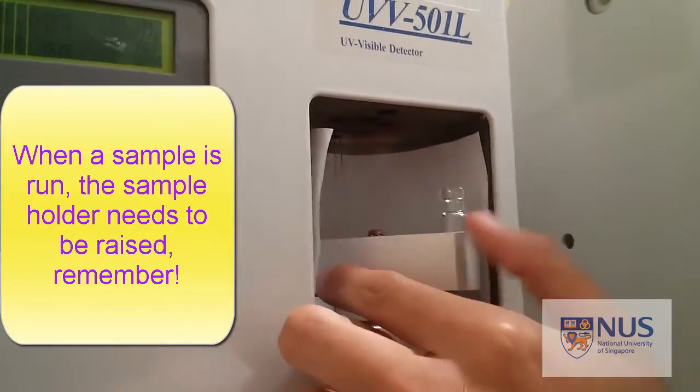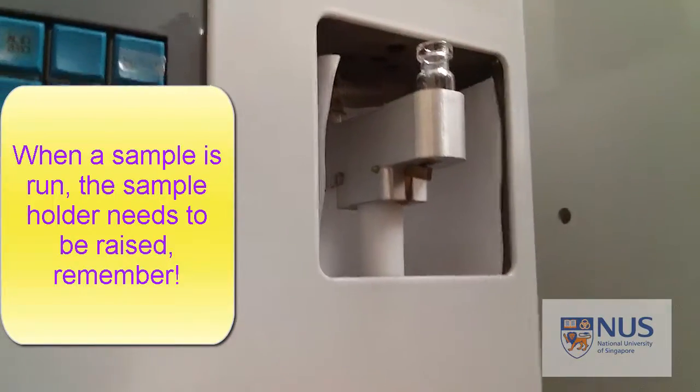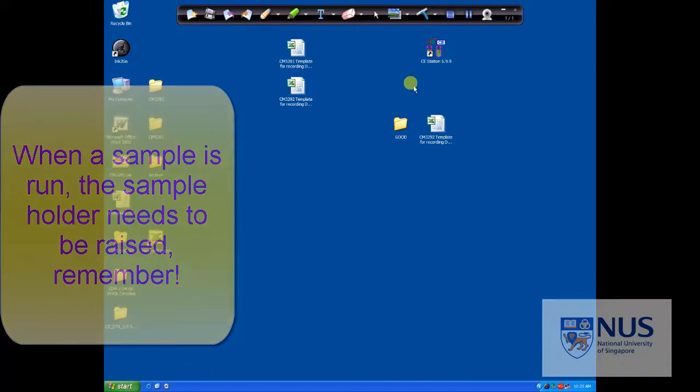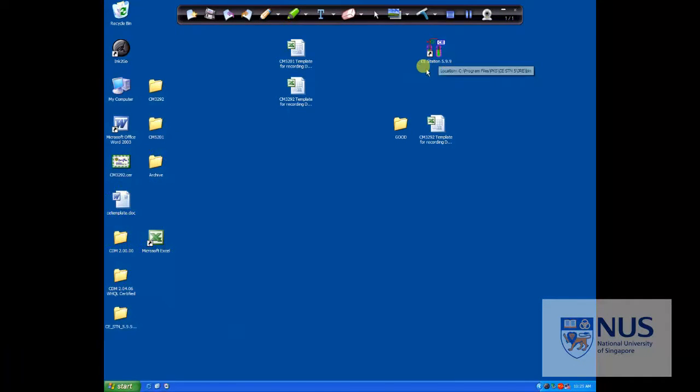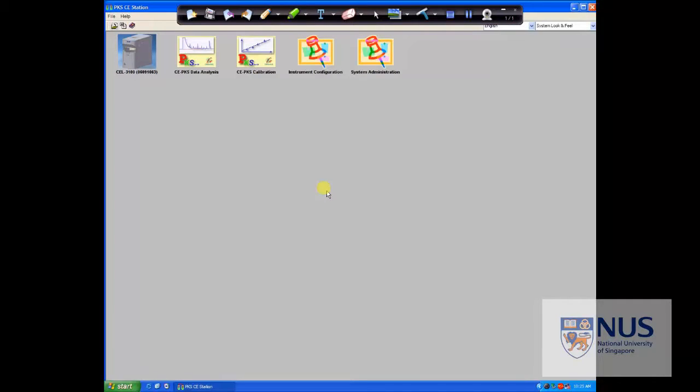Okay, so let's just walk through this. We have a screen and you select the software, CE Control software. On the screenshot it's on the right. Double click it, it takes a couple of moments, and then you end up with the main system icons across the top.